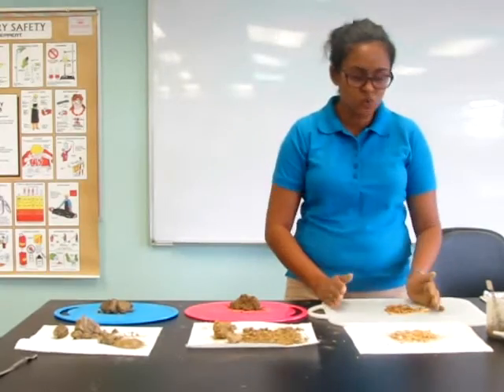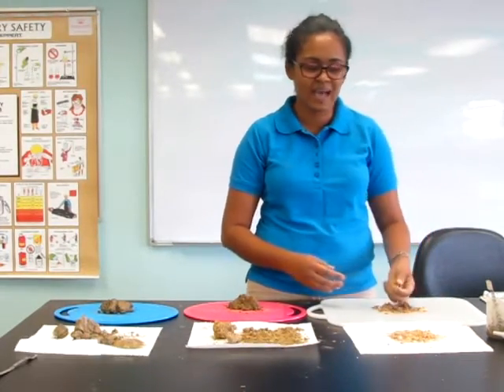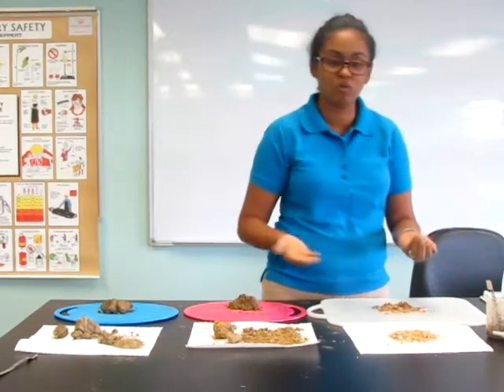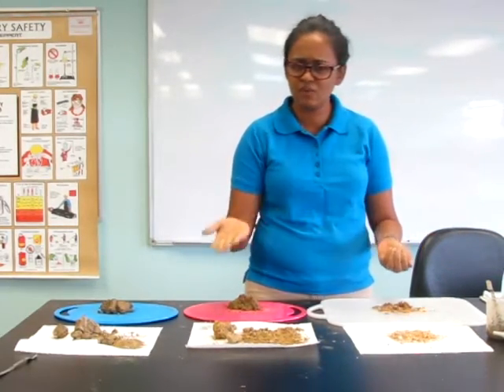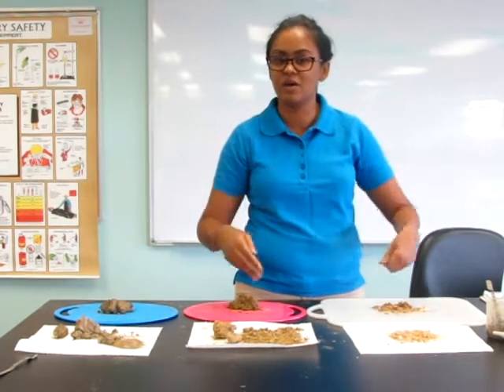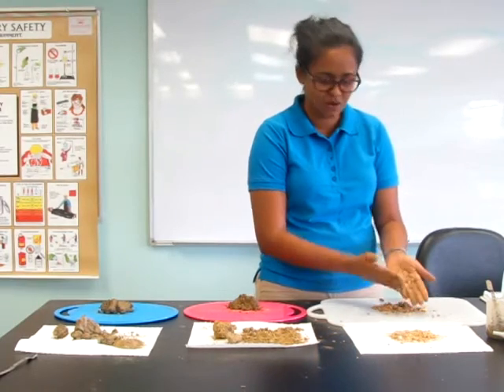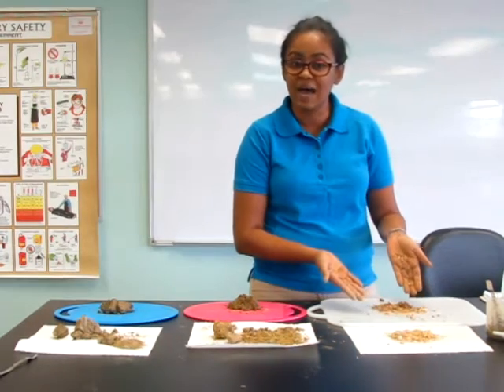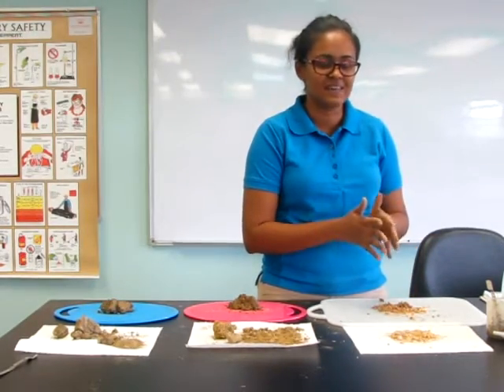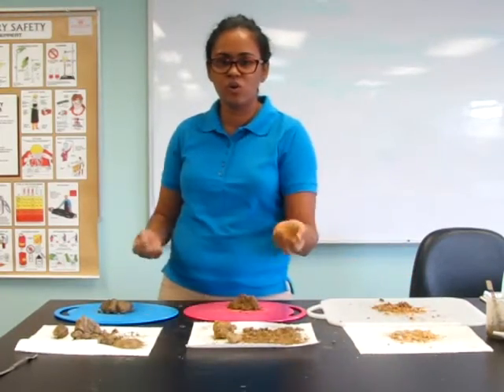We are now going to do our ribbon test. Soil sample A has been moistened with some distilled water. We are now going to roll it into a ball. If it rolls into a ball, we could move to the next step, which would be to roll it into a ribbon. But this soil sample does not go into a ball — it falls apart. By seeing this, we can assume that it is a sandy soil because it has no cohesion.